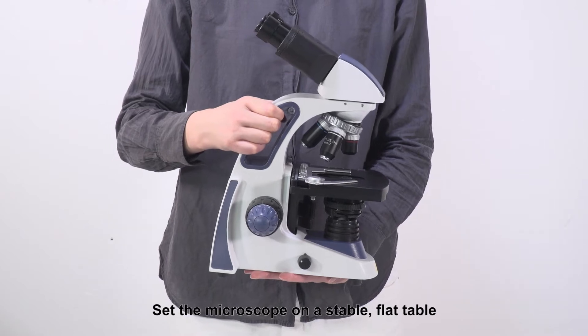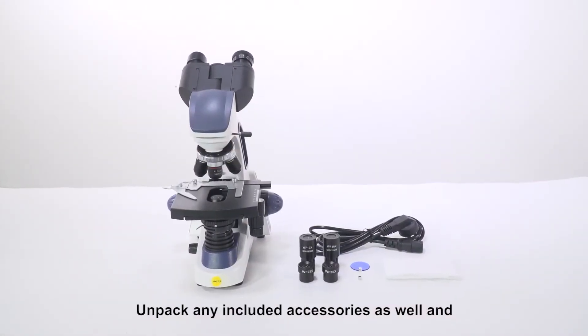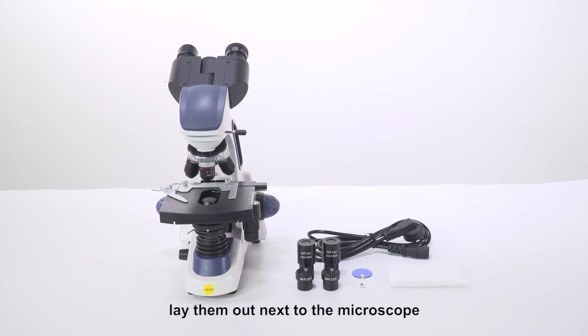Set the microscope on a stable, flat table. Unpack any included accessories as well and lay them out next to the microscope.